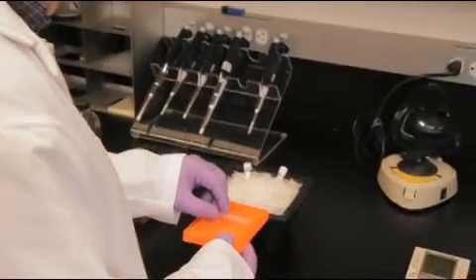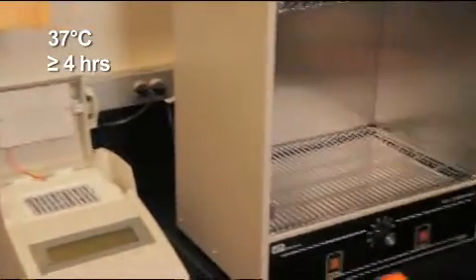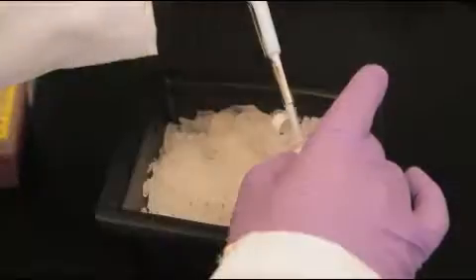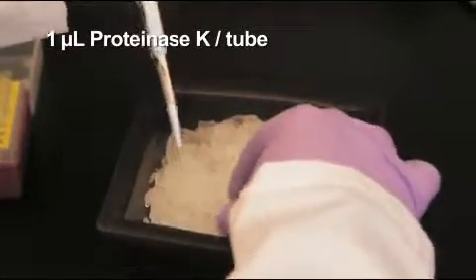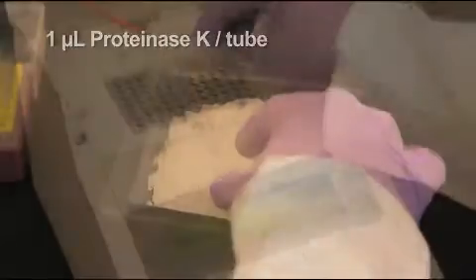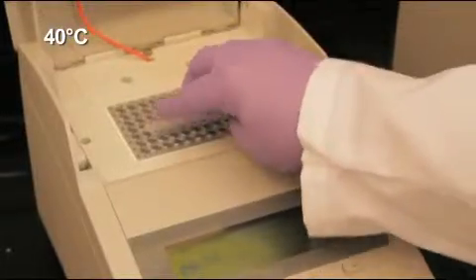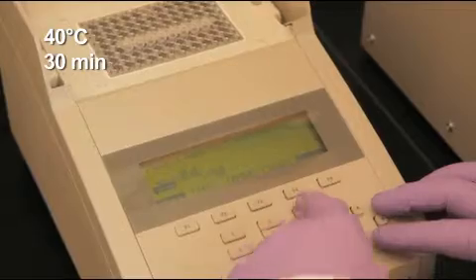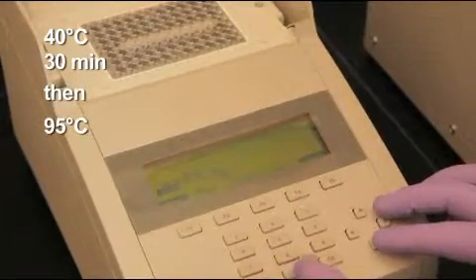Incubate all 6 tubes at 37 degrees Celsius for at least 4 hours. Then add 1 microliter of proteinase K into each tube and incubate at 40 degrees Celsius for 30 minutes. Finally, inactivate the proteinase K by incubating at 95 degrees Celsius for 10 minutes.